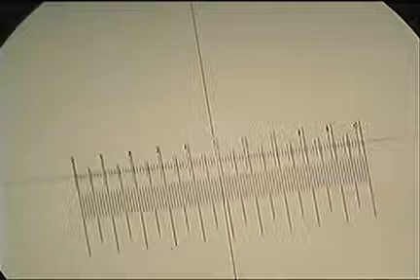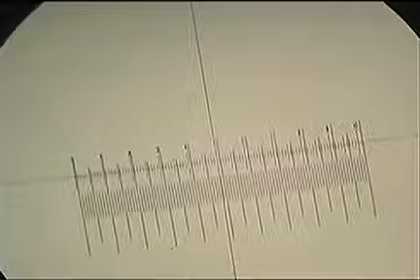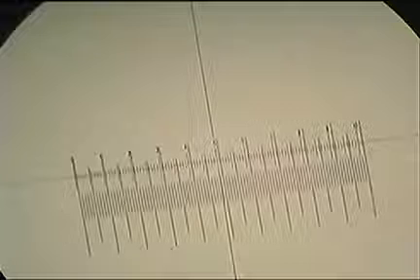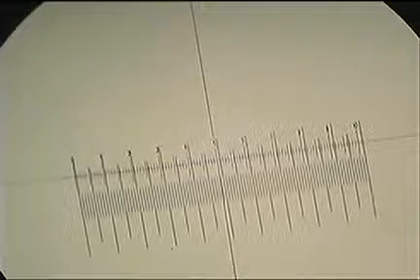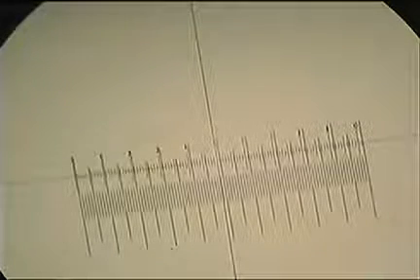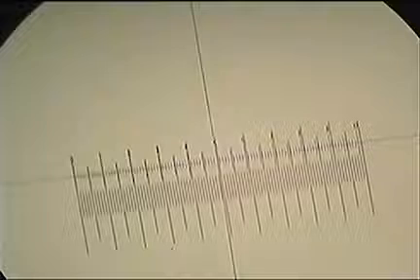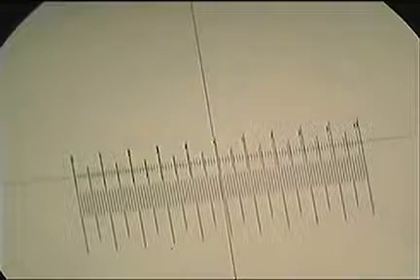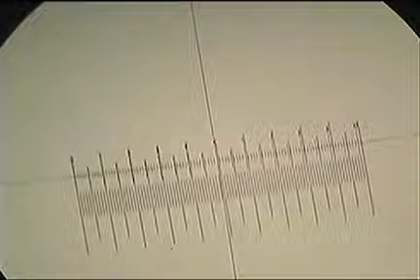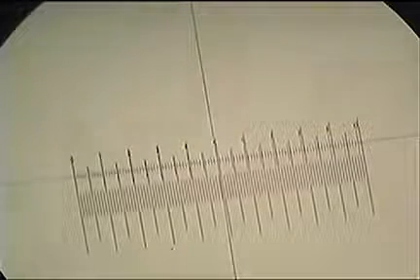I've lined up at the 0, and a little bit of a hint there: if you're trying to rotate it, it's often easier to rotate the eyepiece rather than the slide, since everything's a little bit back to front when you're moving things. Cool. So now I've lined up the 0 and the 0 on the left hand side from both our scales. So that point's lined up. Looking for a line at the other end that lines up, along the eyepiece at about 9.6 on the top scale, I've got two lines lying exactly one on top of the other.